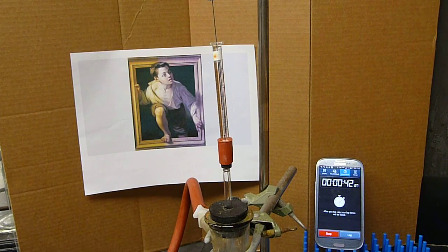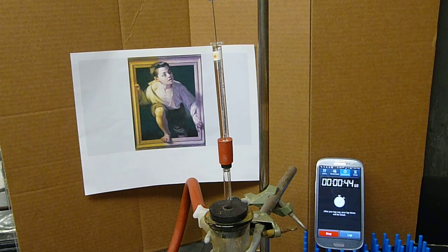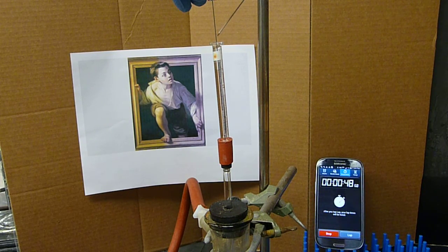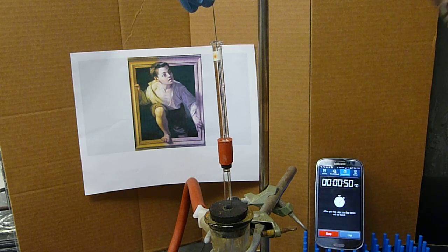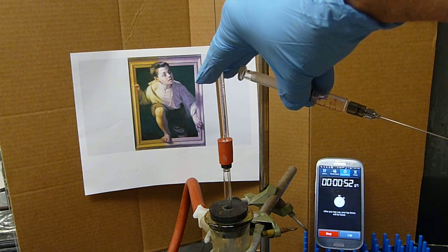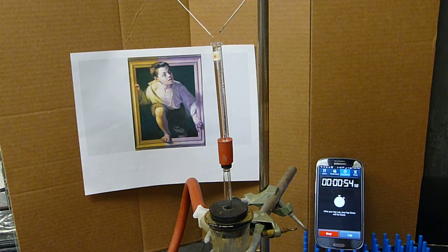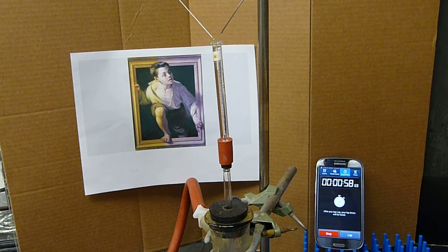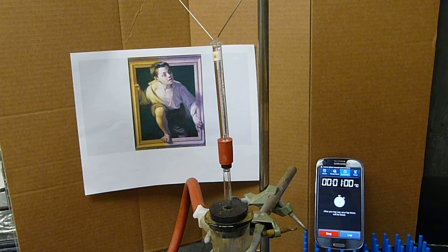All right. I prefer gas-tight syringe, blunt nose needle, 25 microliters in the U.S. They run about less than 40 bucks a piece.